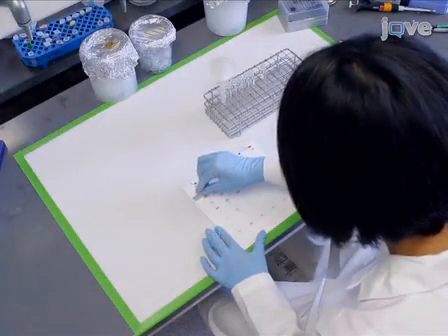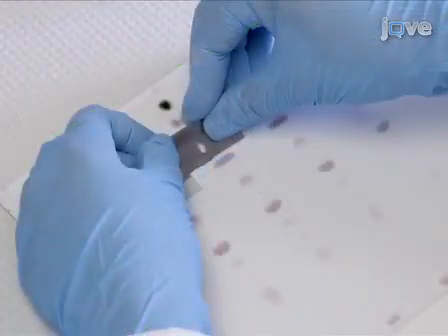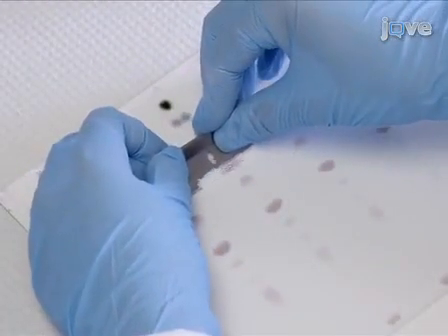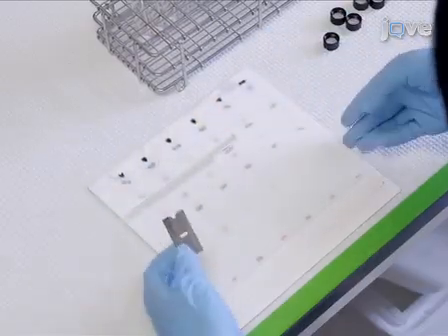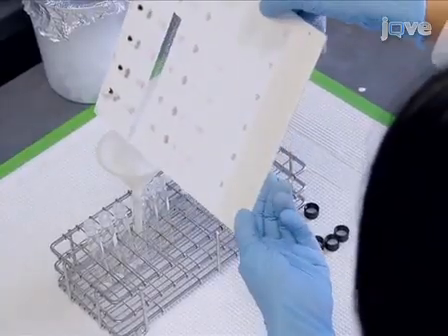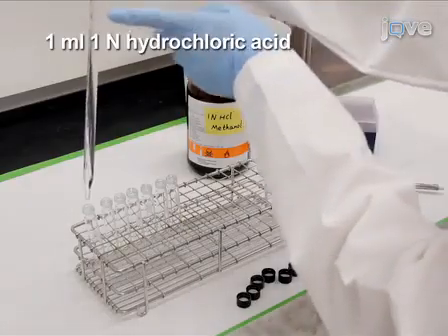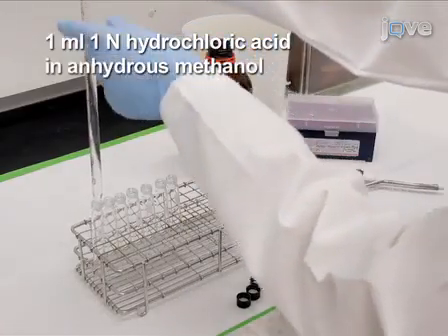Remove the silica surrounding identified lipid spots from the TLC plate with the razor blade and scrape the lipid-containing silica. Using a funnel, transfer the silica powder into a glass tube with a Teflon-lined screw cap. Add 1 ml of 1N hydrochloric acid in anhydrous methanol to each sample by glass pipette.